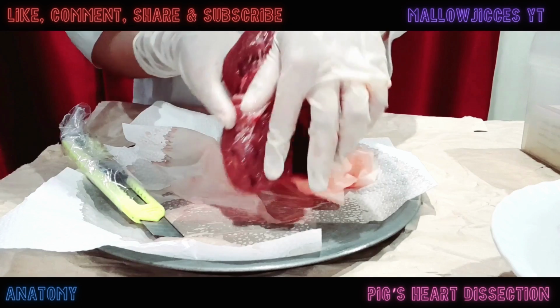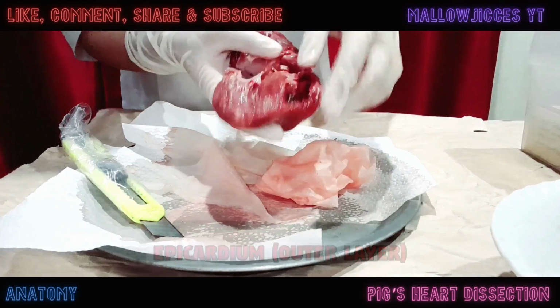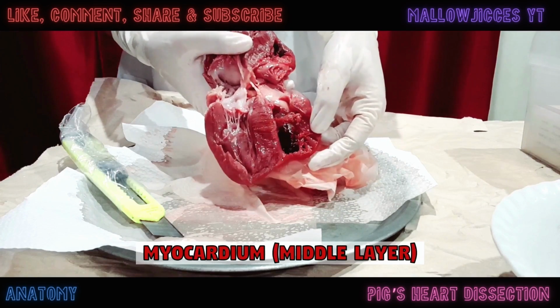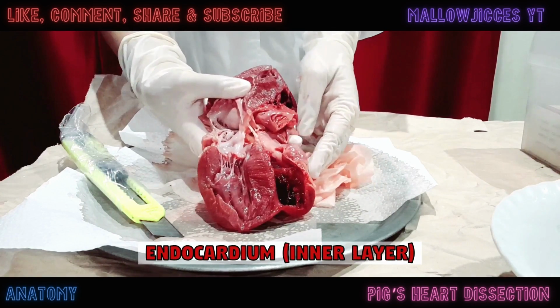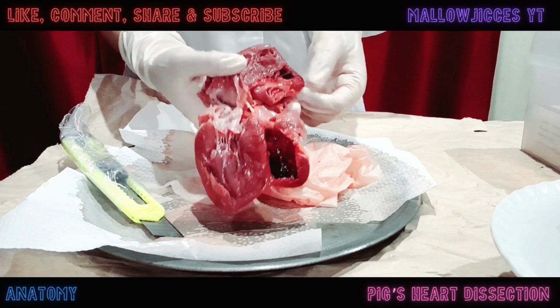And for the different layers of the heart wall, the epicardium on the outer side, the myocardium in the middle, and the endocardium on the inside. And that is all the observable parts of the pig's heart.